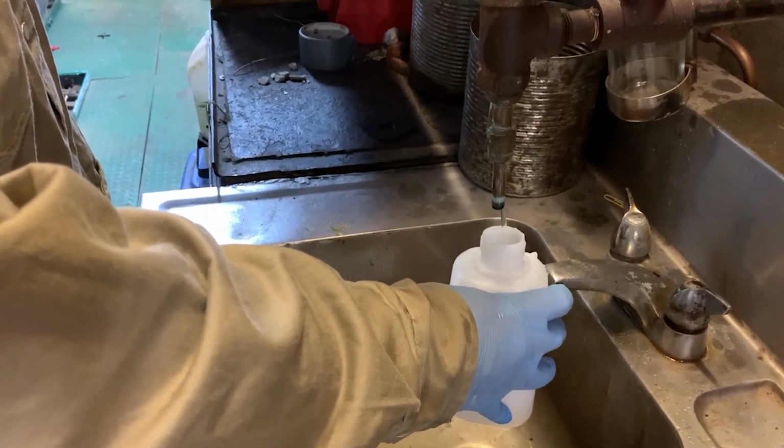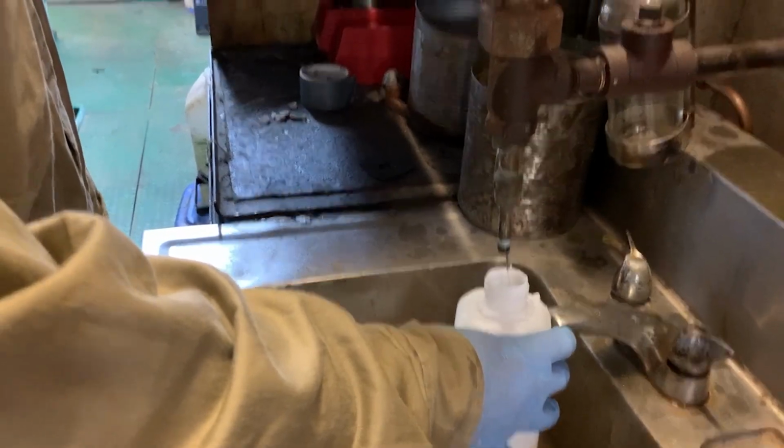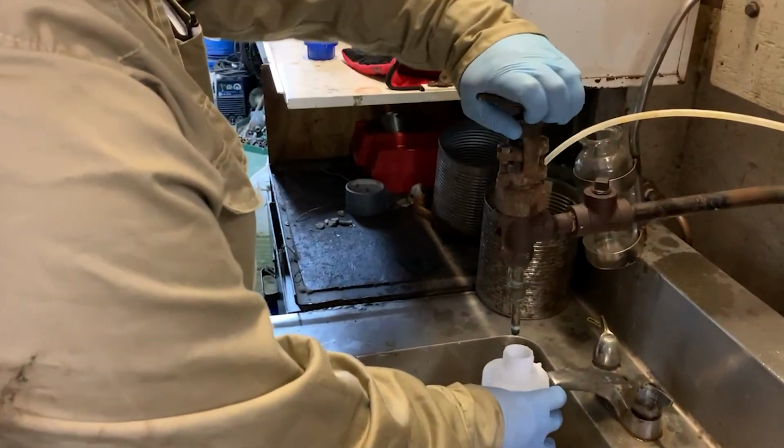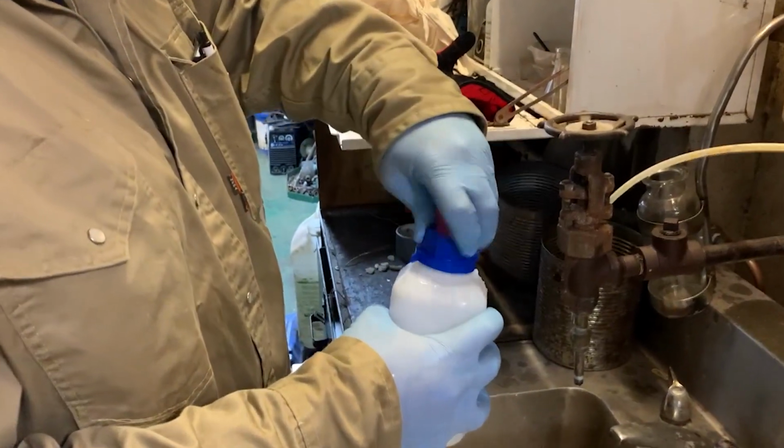Appropriate safety precautions are to be taken while collecting samples to avoid any injury. The sampling procedure shall be such that a correct representative sample is being drawn. This helps to ensure correct implementation of the treatment program.